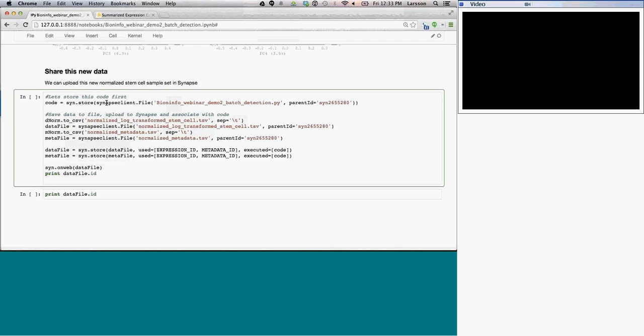Last thing we're going to do is we're going to store this in Synapse. So the idea is basically we pull data in, and if you do an analysis on it, you can pull it up, you can store it back to Synapse and share it, and then indicate what you've done with the data. So the first thing we're going to do is we're going to store this code that we've been running. So store, and we're going to store a file, and I'm going to store this file that I've been working on right here.